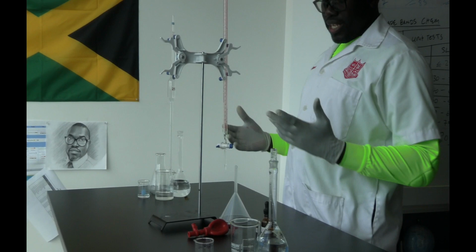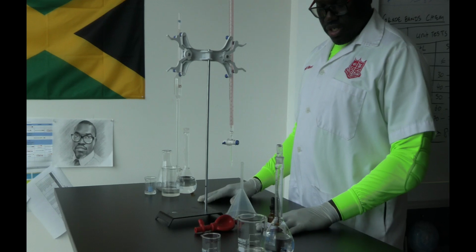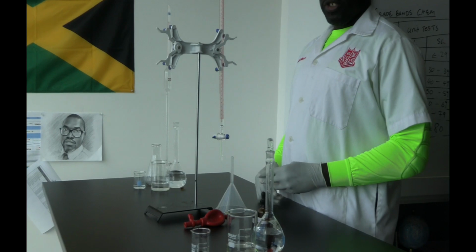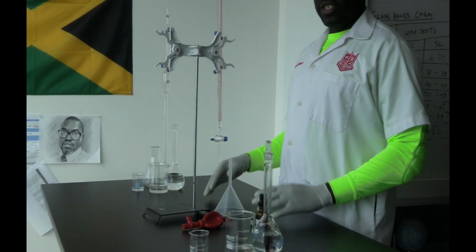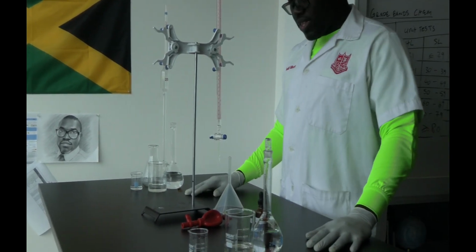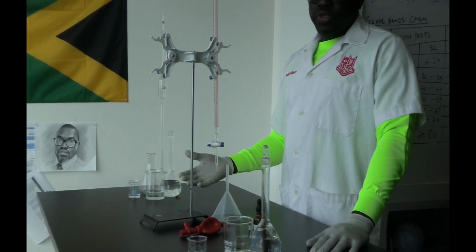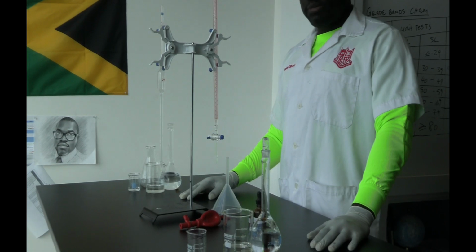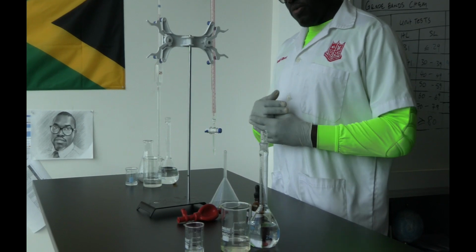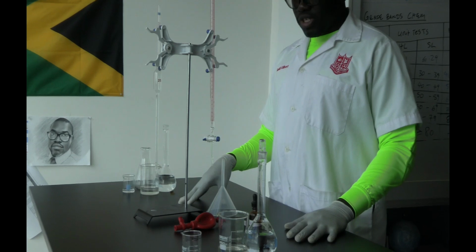Okay, so we are doing a colorimetric titration. As I said before, there are several types of titrations. You have colorimetric, where you look for a color change. You have photometric, where you can use light changes. You have conductometric, where you look at conductance changes within the solution. You can have thermometric titration, where you measure the temperature changes. You can have spectrophotometric, where you look at changes in colors and absorbances throughout the titration. Of course, we have pH titration as well, where you measure the pH change in the titration. But for today, we are just going to look at a colorimetric titration.